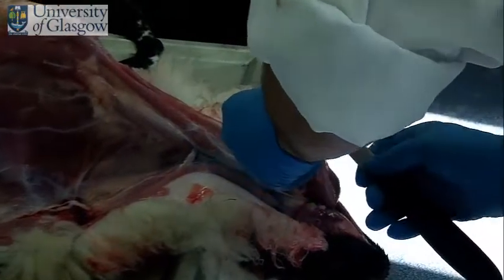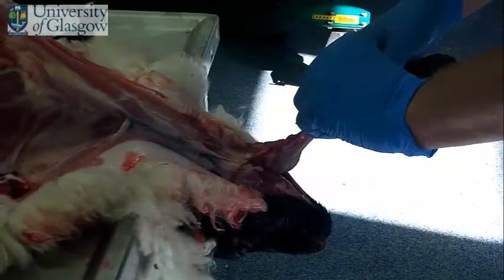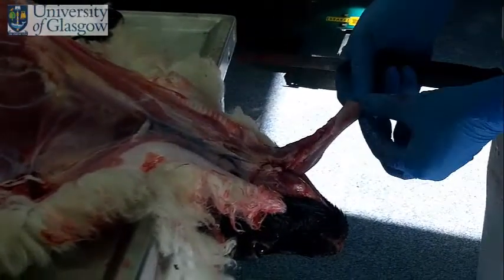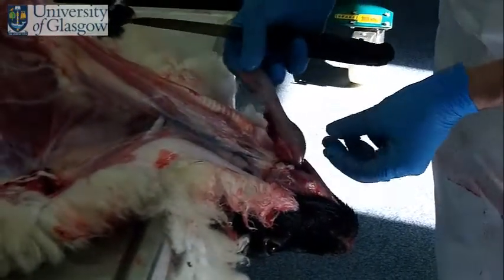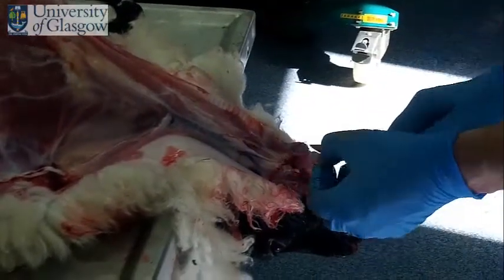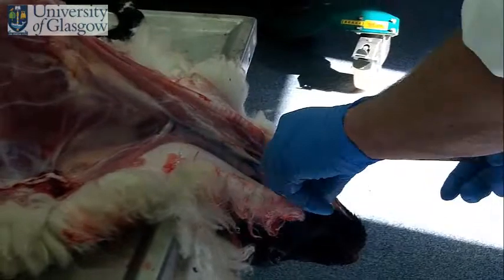Just using the flat knife here, gently take off the mucus. Just have a look at the tongue and make sure there's no ulceration. The tongue looks perfectly normal.